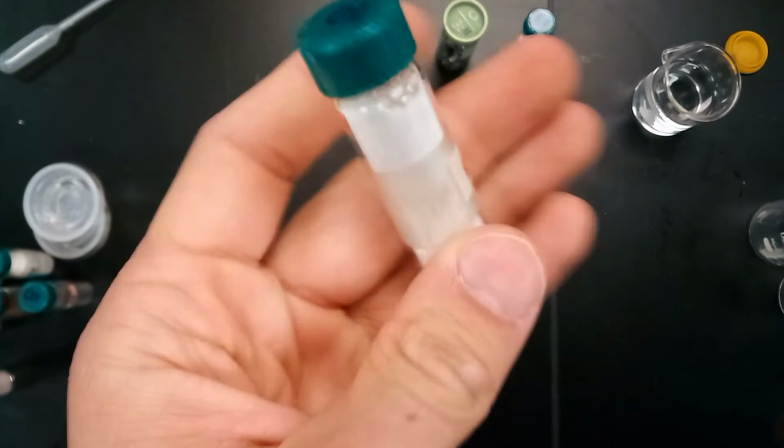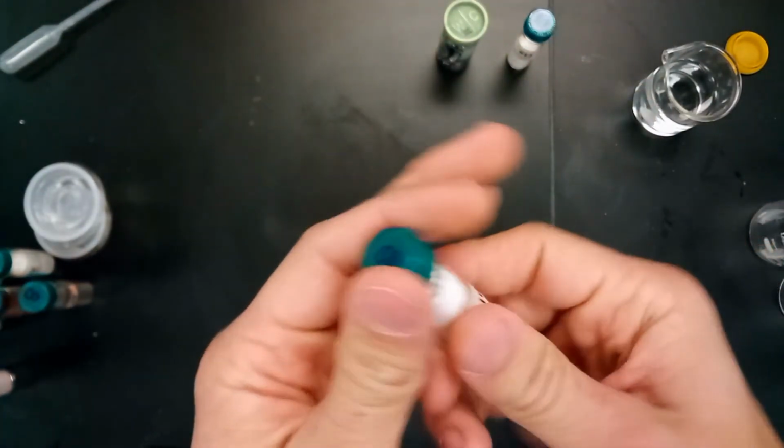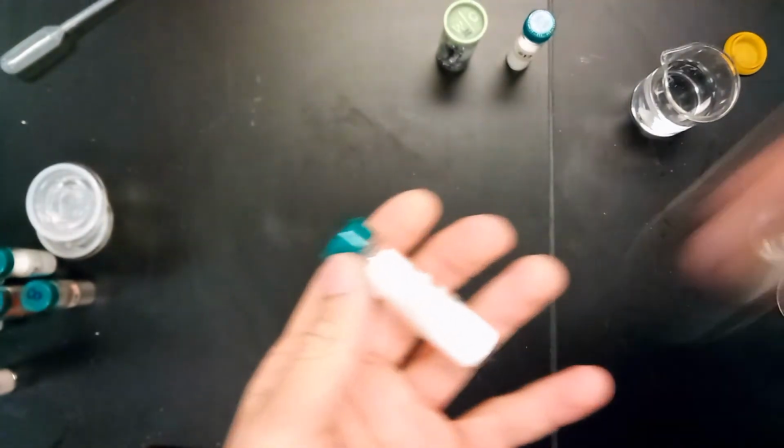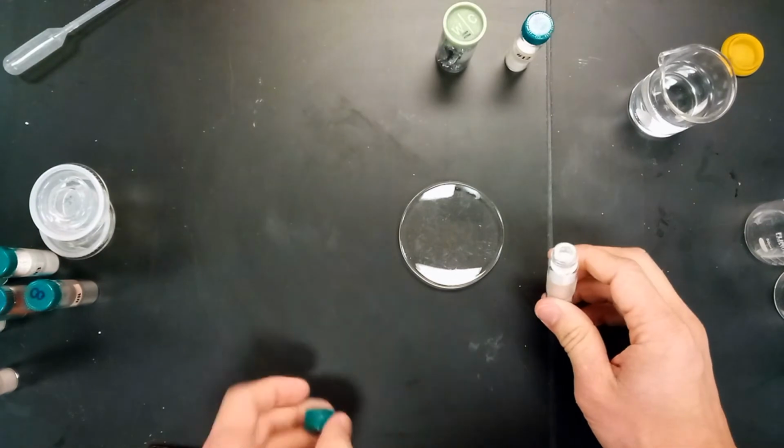We're now going to work here with number 10, like we said earlier, also one of these white powdery substances. So again, there are basically 2 things we're going to try to do with this one.